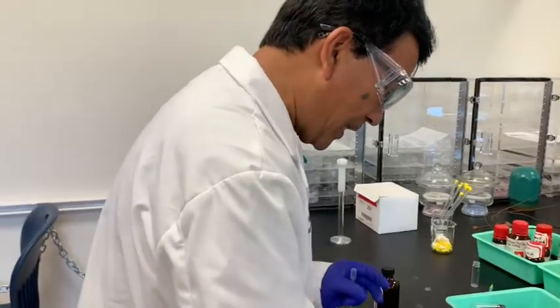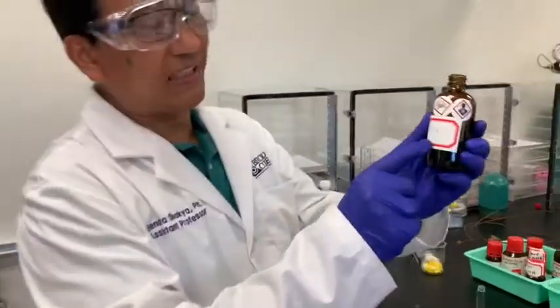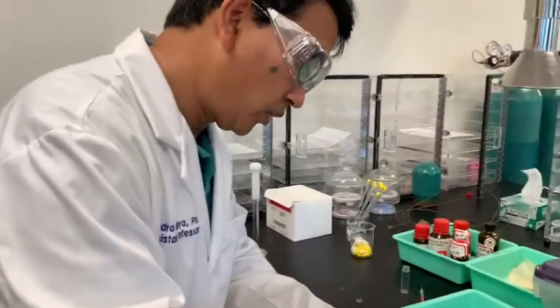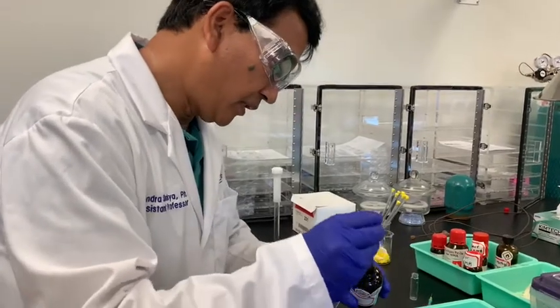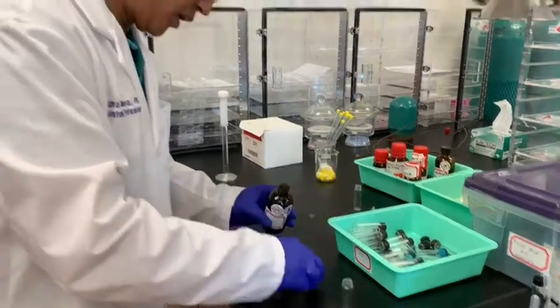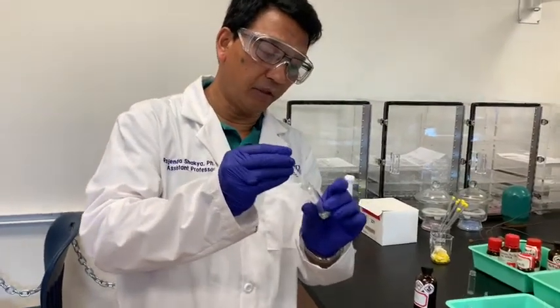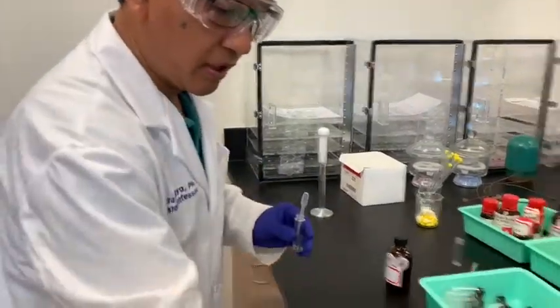All right, now for this I need to dissolve it in a solvent. So I will use CDCl3, deuterated chloroform, for that. So just take this chloroform there, and I will use that here. Okay, maybe a little bit more. Okay, once I make this, I want to make this into a solution here. It's a very transparent, clear solution.